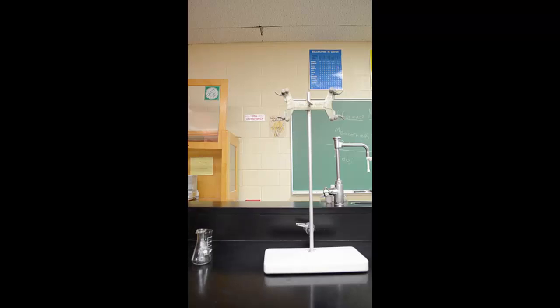Next up is the burette. The burette is this long tube with the stopcock at the bottom. It measures about 50 milliliters, and this is how it works.